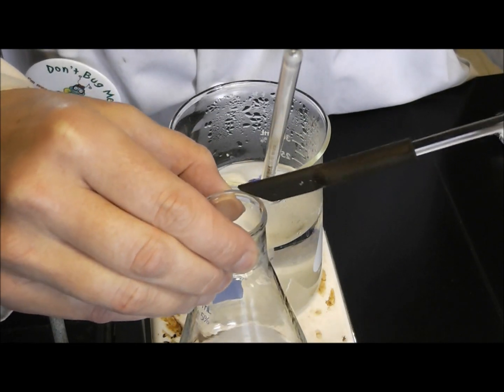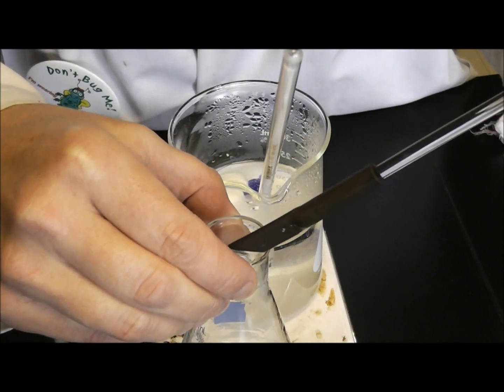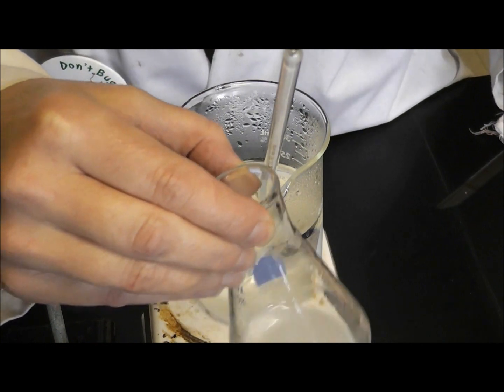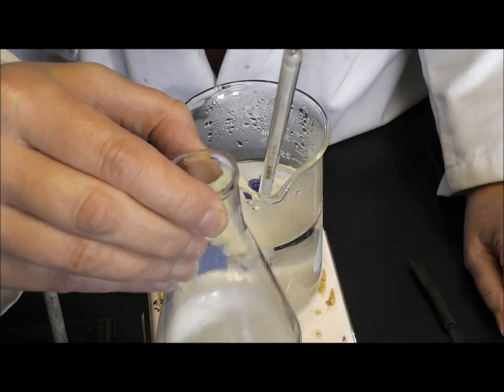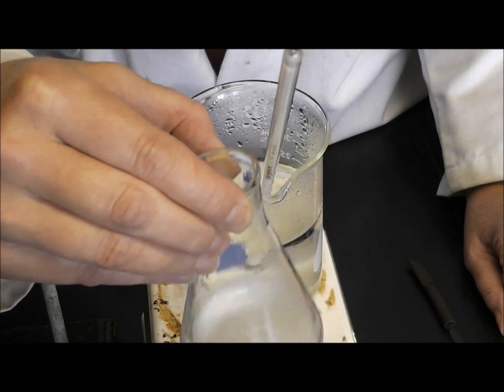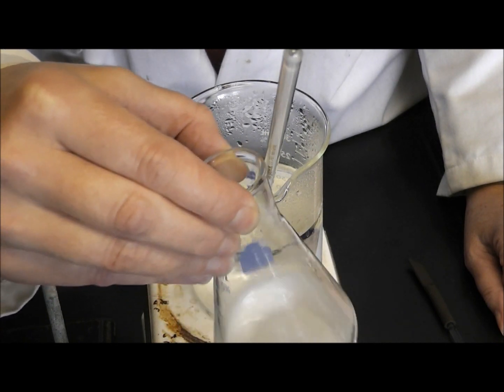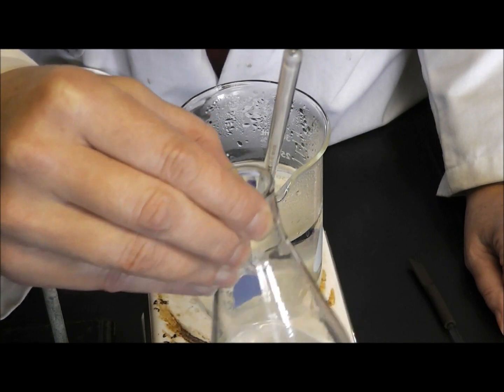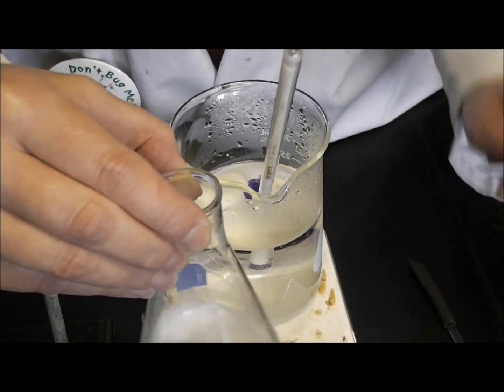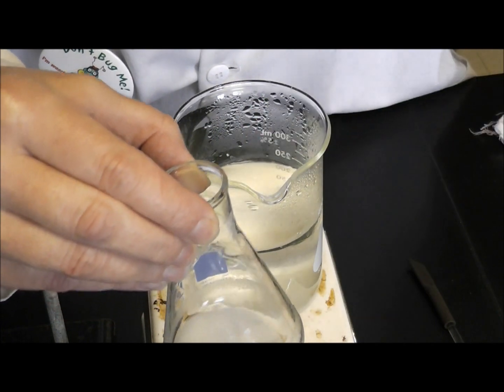This is my Rubber Policeman, so I'm going to swirl it like this as opposed to the Rubber Policeman right now. I'm going to swirl my Erlenmeyer and mix it real well, and then my water bath is at 70, so that's perfect.